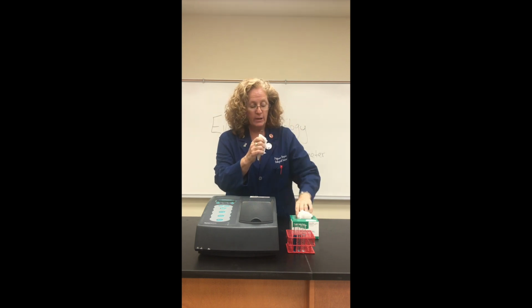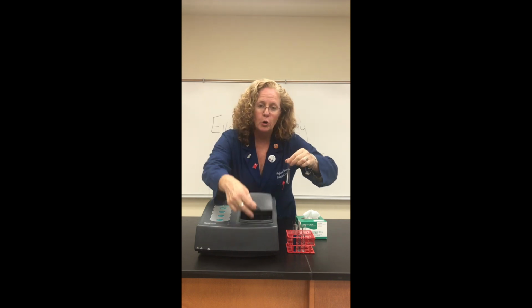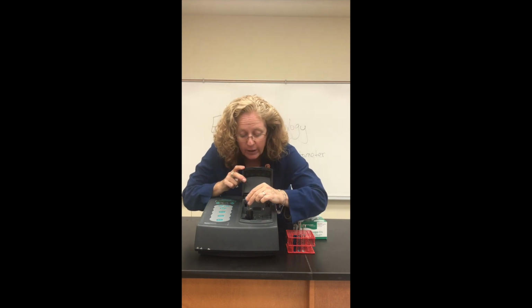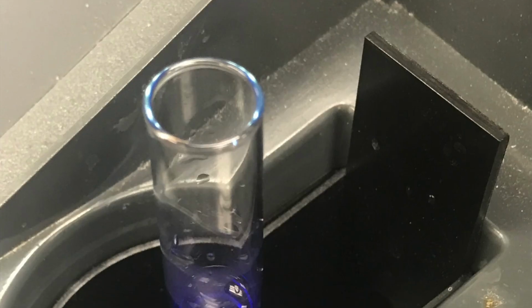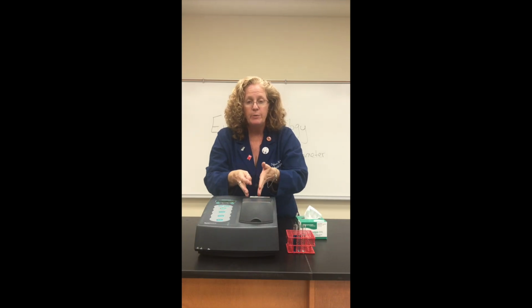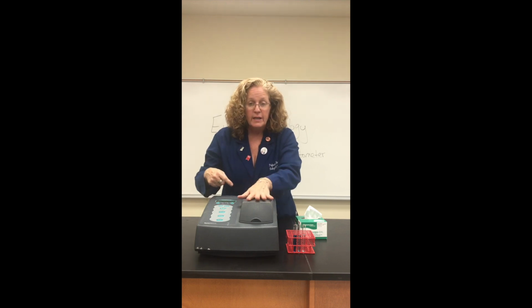We're going to take what's called a Kim wipe here, and we're going to just wipe down the tube. Make sure there's no fingerprints, dust, dirt, anything like that that might interfere with the light. We then open this chamber right here, and we're going to put this round peg in a square hole. Push it down like that, and then close the door. Light is going to be passed through. It's going to shine through that test tube onto a sensor plate, and that sensor plate is going to give us a numerical reading. This is the blank.